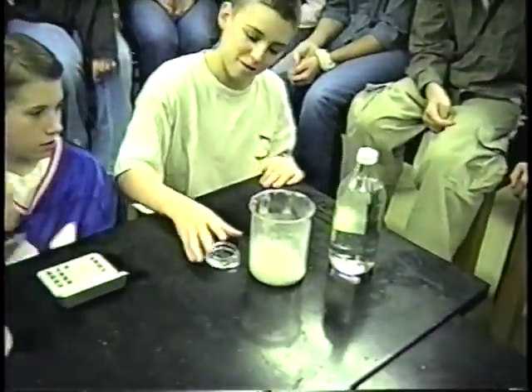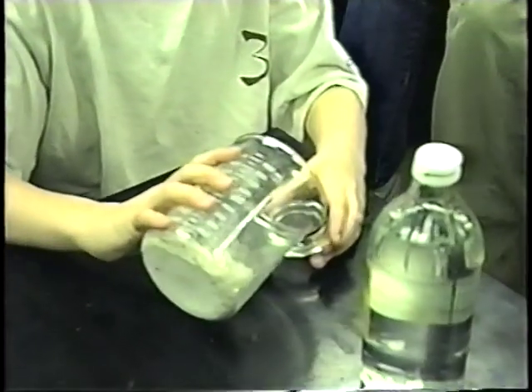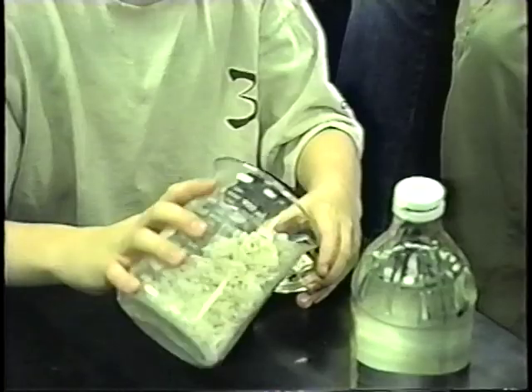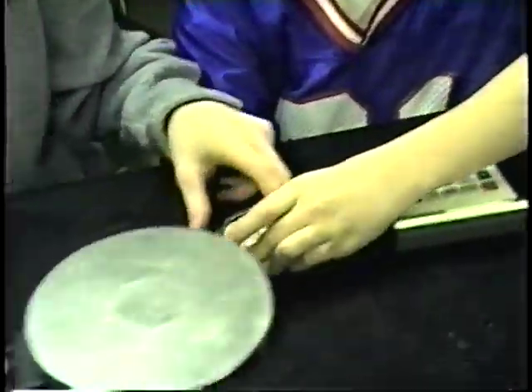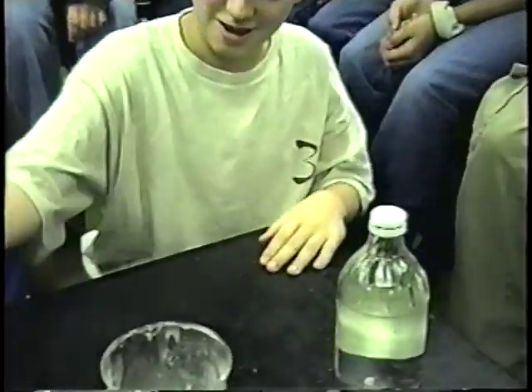Matt, carefully place some rocks, some limestone into the watch glass there. Come on, nice and slow. Okay, very good, Matt. And if you would weigh that up one more time for us, and if you could pass over your beaker, Matt will put in some vinegar for you.